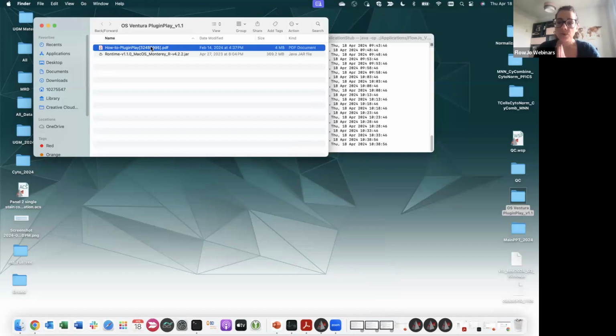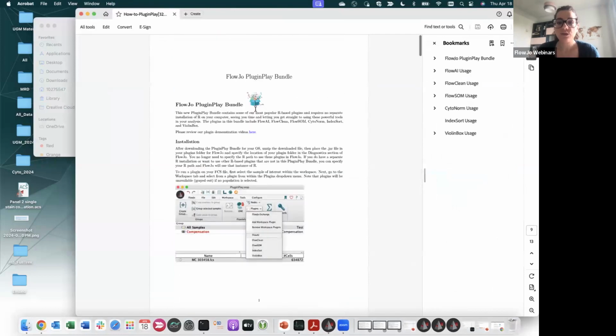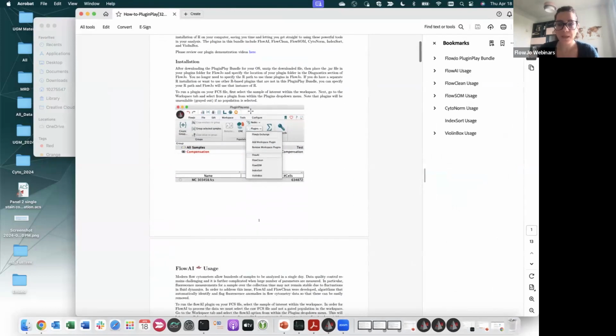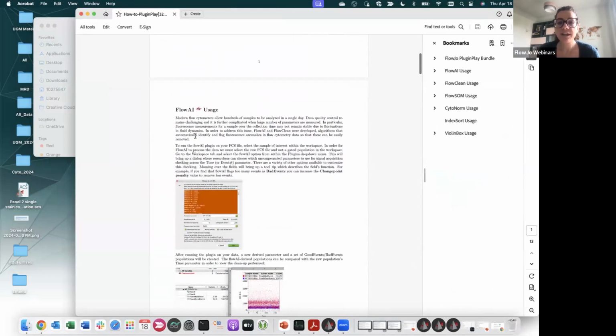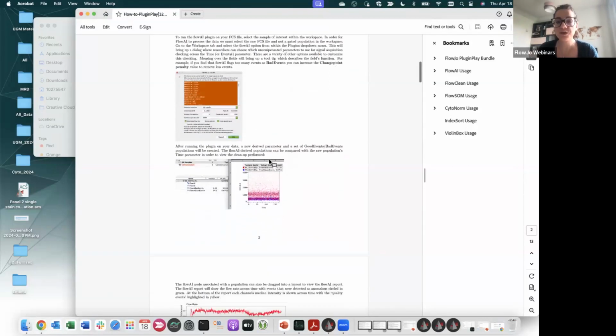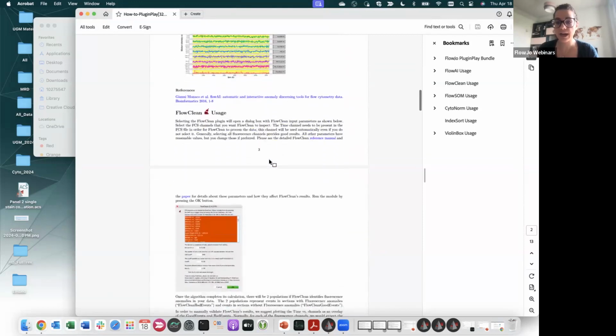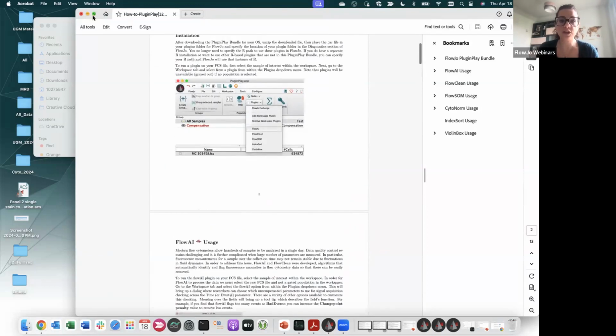So please read the PDF every time you download a plugin from the Exchange, for two reasons. One, because there is information on how to install the plugin, which is basically a copy and paste into the plugin folder. And then because you will find information on the use, and you will find details on the publication of this algorithm specifically, how to use it, which are the outputs, and so on. So all the information that I shared with you is also available in the PDF of each plugin.